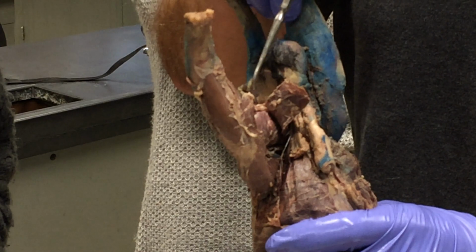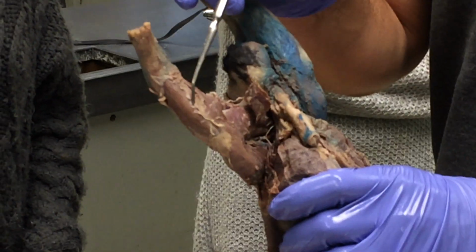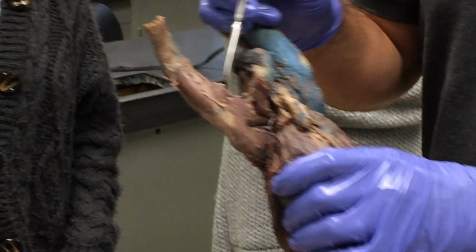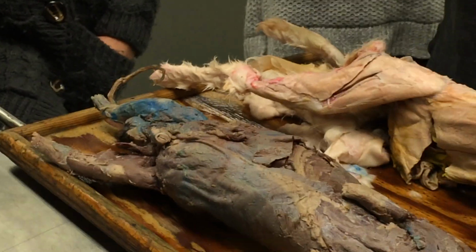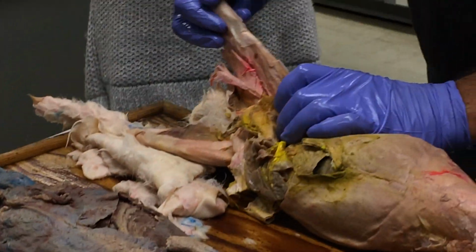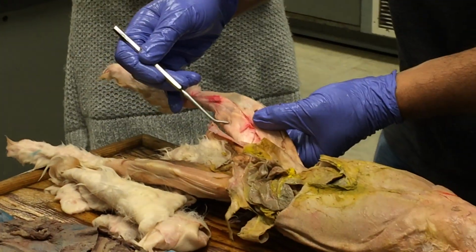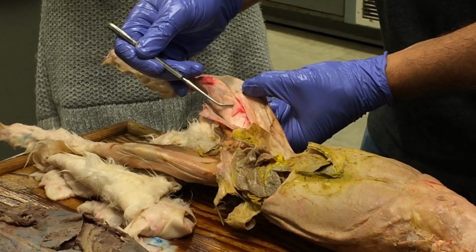Okay. So this is, again, for you guys over there, semitendinosus, semimembranosus. The semitendinosus comes further down the shank than the semimembranosus does. And it also tends to be thinner, which is why I should have really realized that wasn't it. But anyway, so that's on this guy. And then here, the same thing. This is the semitendinosus here, and the semimembranosus here.